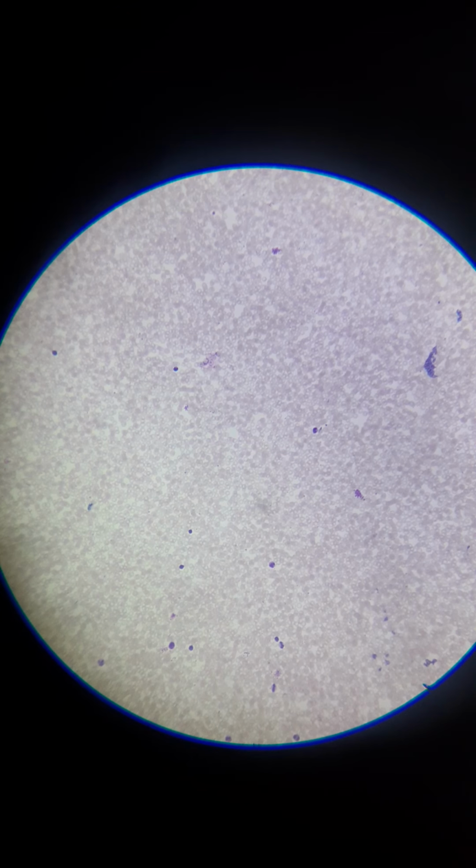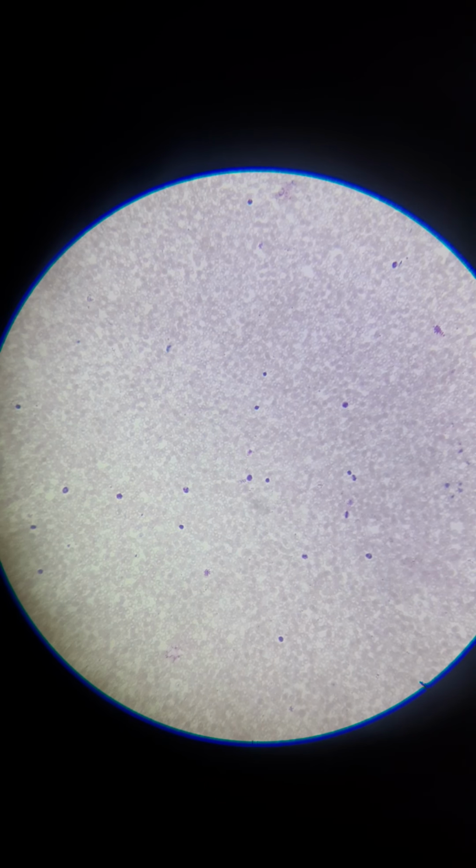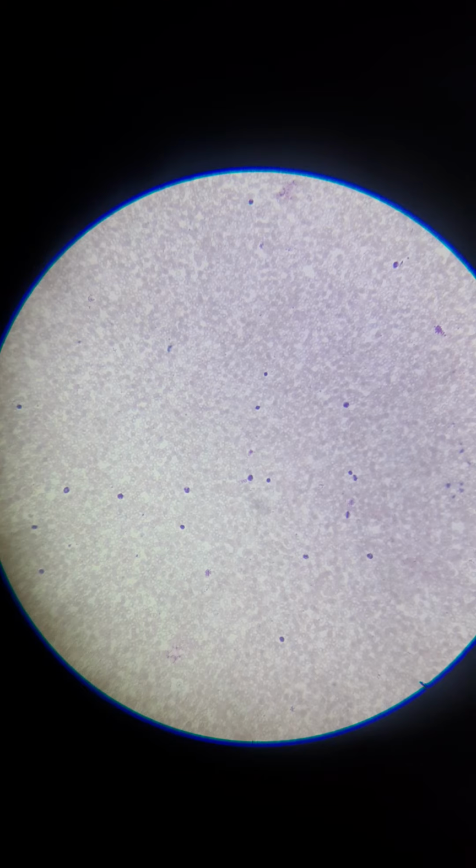So this is actually human blood. I'm going to zoom in here in a sec, but you might be able to make it out. It's kind of a grainy appearance across the whole thing, and almost all of that is your red blood cells. And then you'll notice a lot of these areas, there's like a dark staining purple. There's different ones. Let me zoom in here and we can kind of look at them.